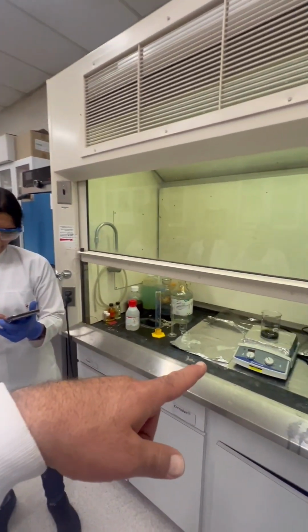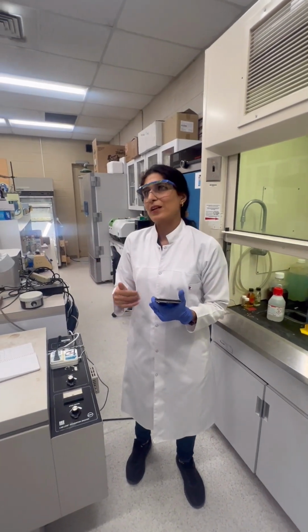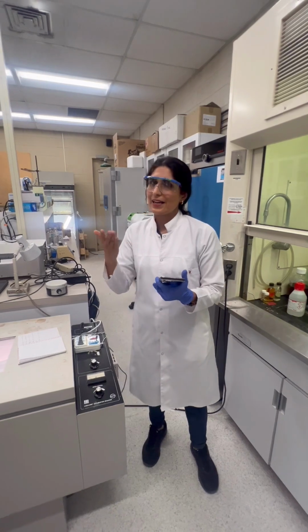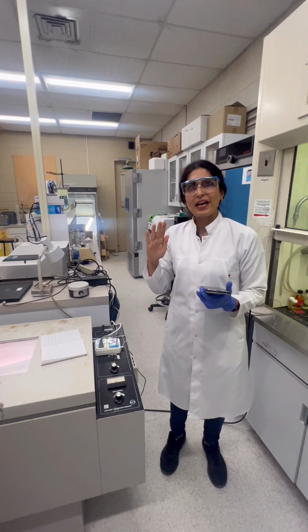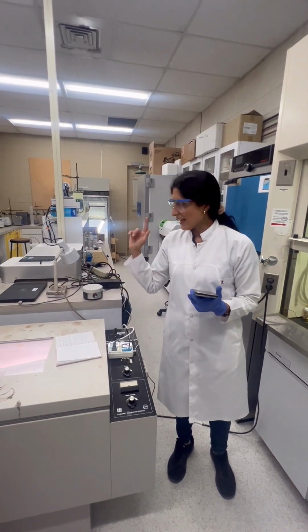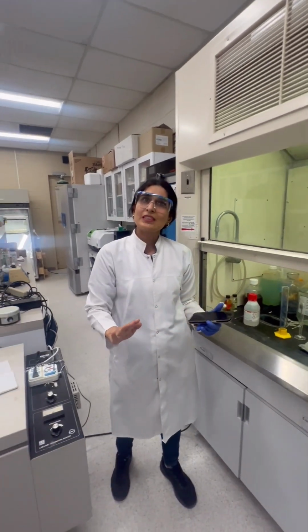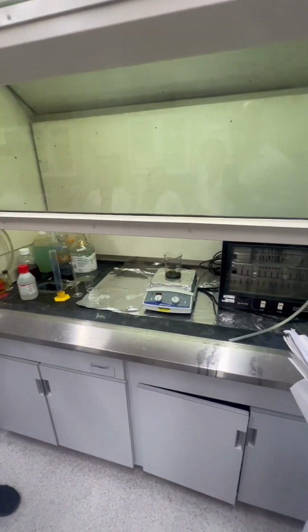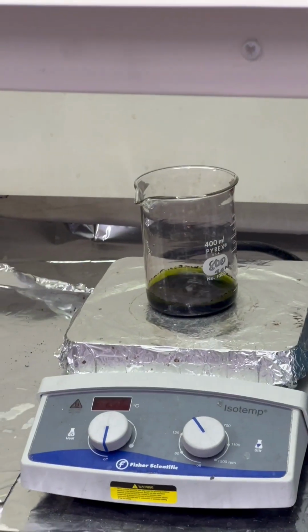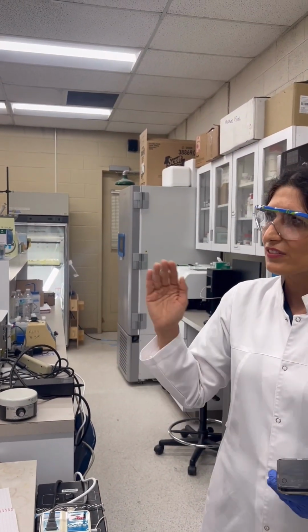So after 6 hours, we rinse it several times with hydrochloric acid and water. It's really important because we remove all unreacted chemicals, with a mixture of 10 milliliter HCl and 30 milliliter of DI water, 40 milliliter. It goes through several stages of centrifuge to rinse it. After adding hydrogen peroxide and finishing the experiment, we add this mixture of HCl and water and first centrifuge. After that, 3 times washing with HCl and DI water.